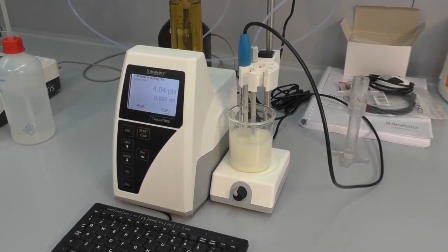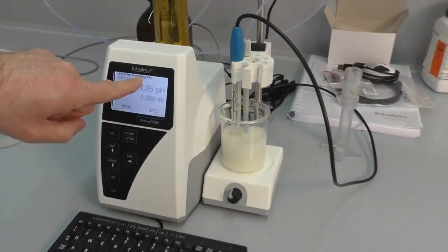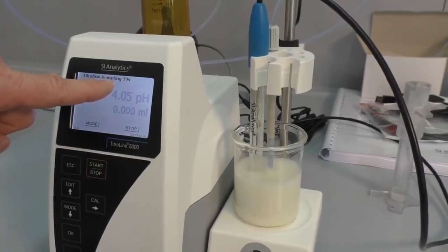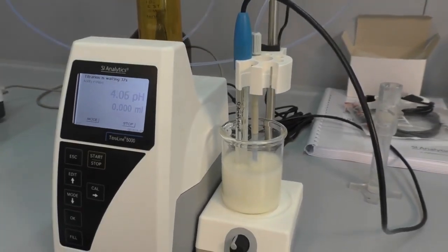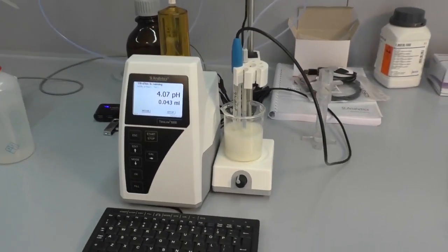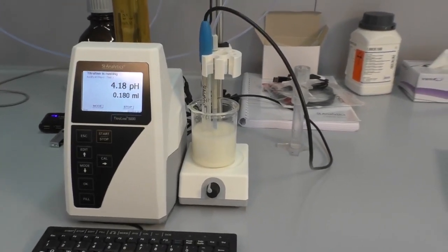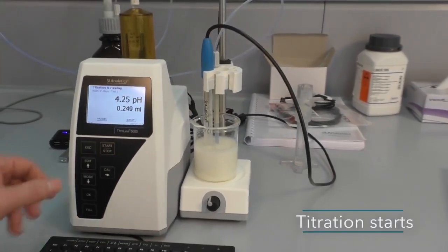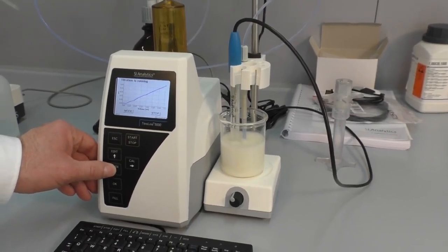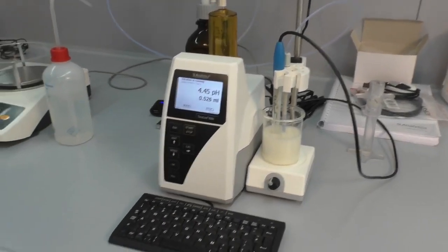So the titration starts automatically. And you can see the titration is waiting because the stirring time was 60 seconds and it's now already at 40 seconds. After the mixing time is finished, the titrator automatically starts the titration. With the mode or F5 key you can toggle between the graphic display and the titration values in pH and milliliters.